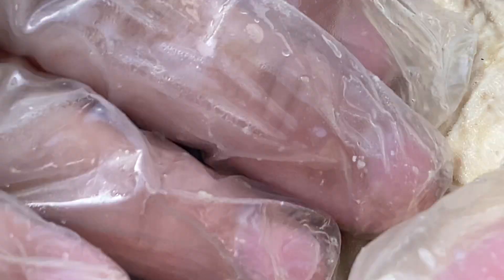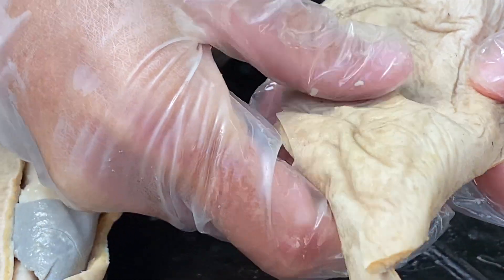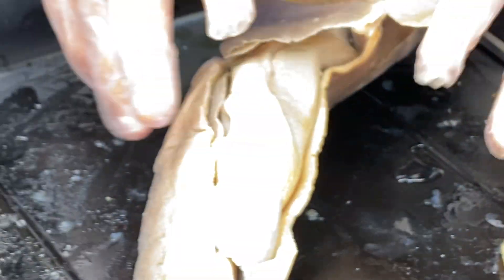You can go really smooth one way, but you can hear it's very scratchy. So if you ever feel a shark, don't rub it both ways — just go from head to tail, it is nice and smooth, but tail to head is definitely more of a rough pattern to it.